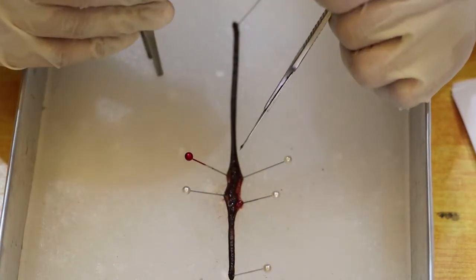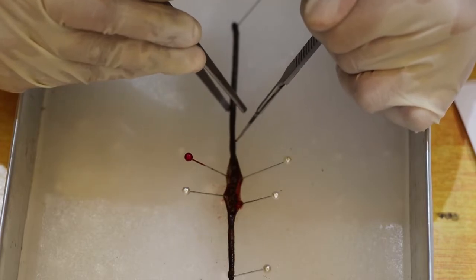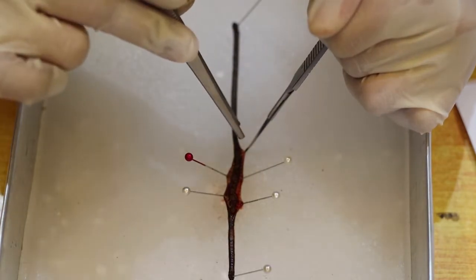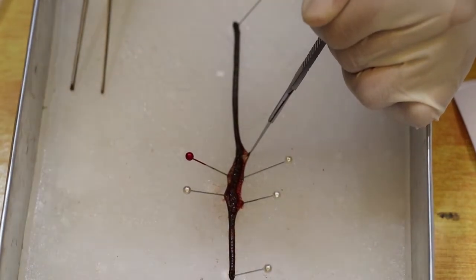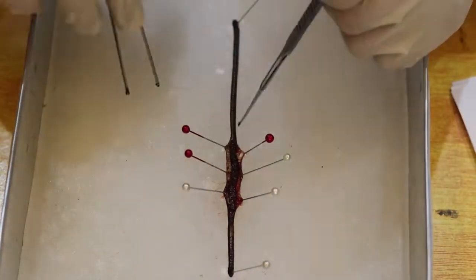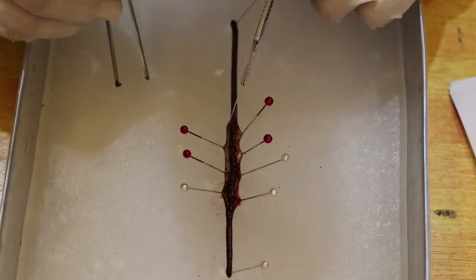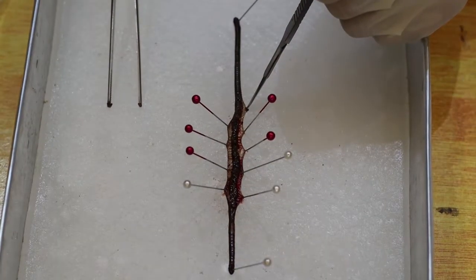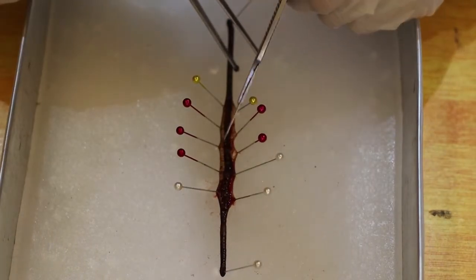So you can see there are thin membranes which separate each segment. This is what you call the septa. The septa is a clear transverse wall of tissue. So let's open it more down to the anus. There is a septa right here, full of septa.